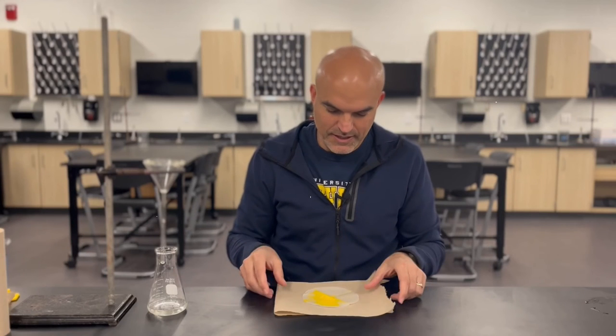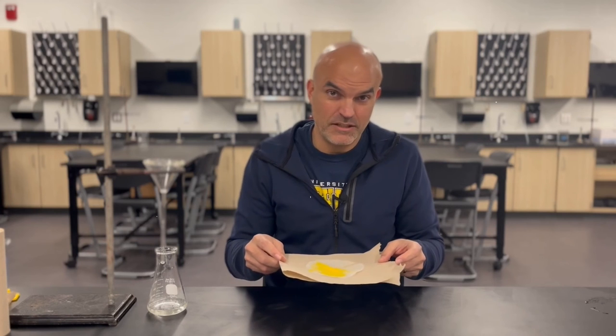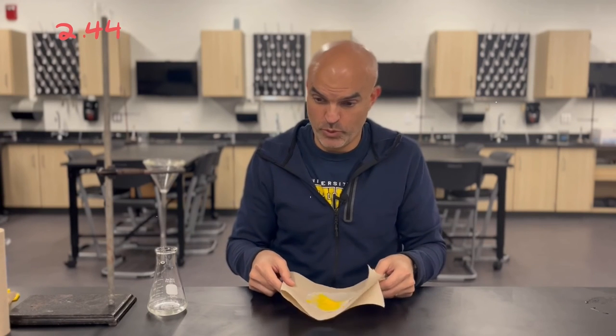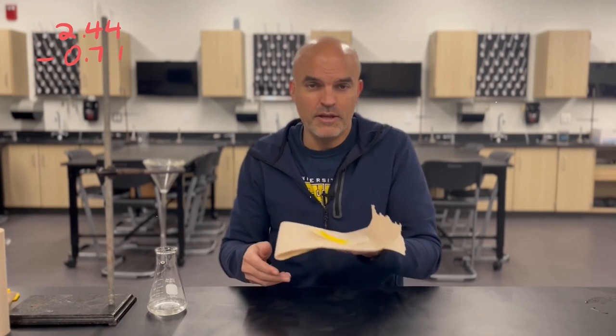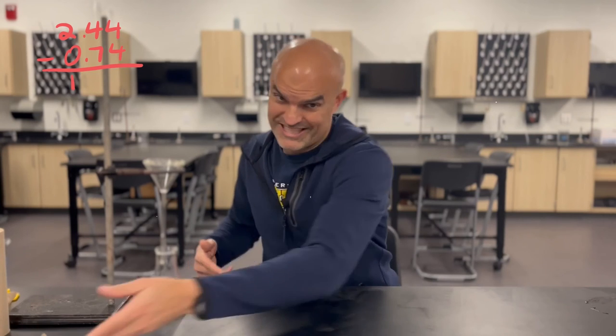We're back. I've got my dried filter paper with precipitate, and I weighed it — it turns out to be about 2.44 grams. That includes the lead iodide and also the filter paper. So I need to subtract out the filter paper mass from when it was empty: 0.74 grams. Taking 2.44 grams minus 0.74 grams, the mass of just the yellow lead iodide turns out to be 1.70 grams.